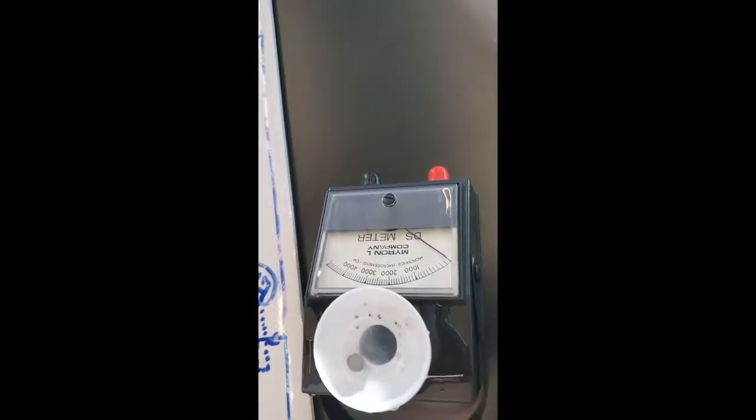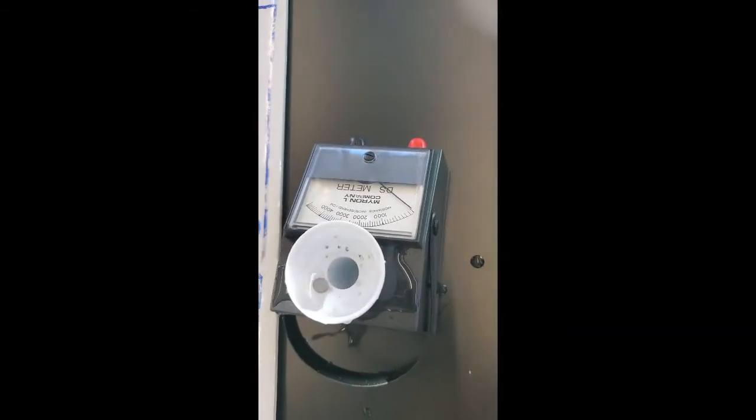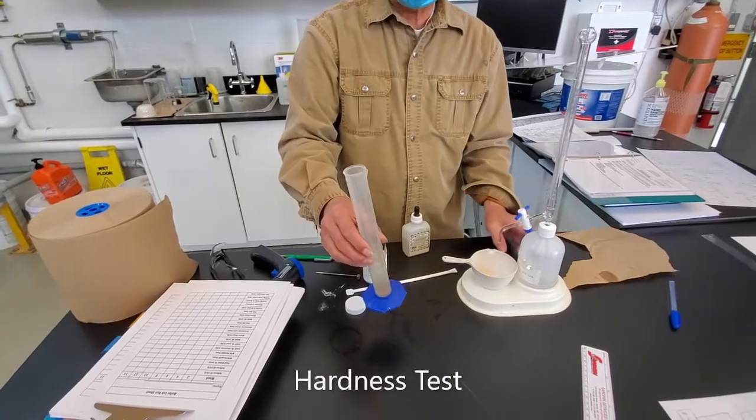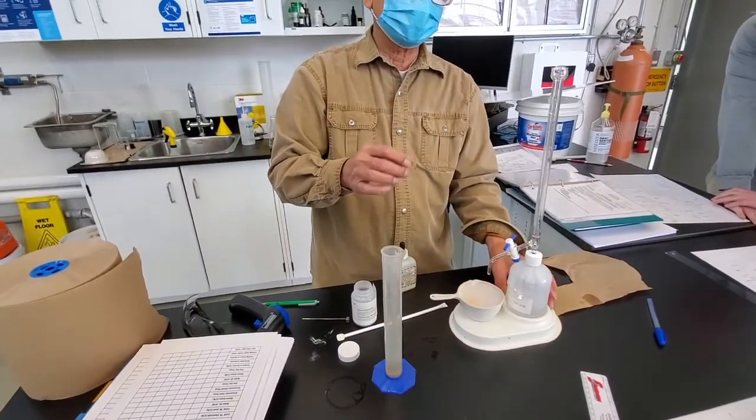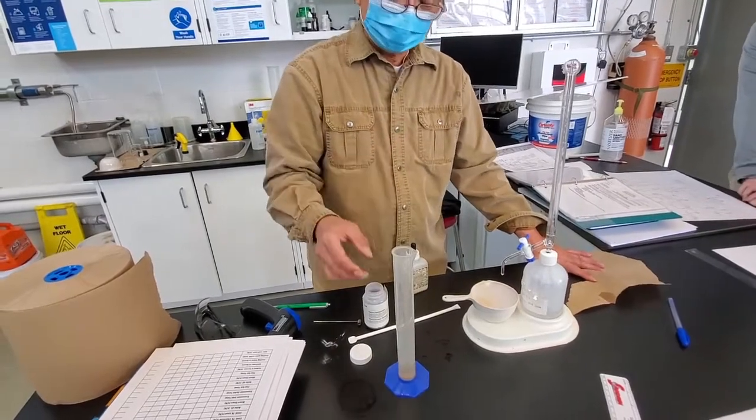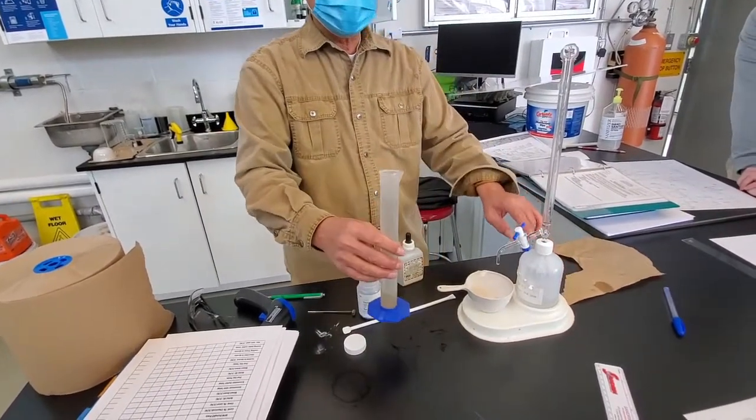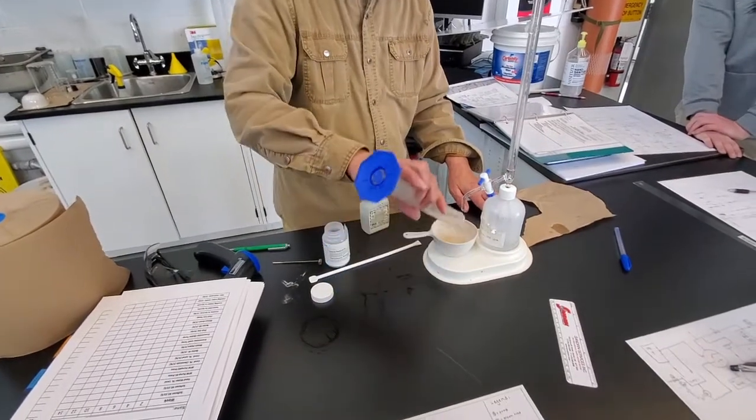Okay, let it go, and then it comes back down. I'm doing the hardness test. Now, the actual hardness test, you have to use 100 ml sample. But since we are low on the titrant, I'm going to use a little bit in there.